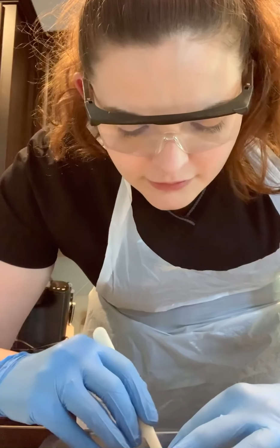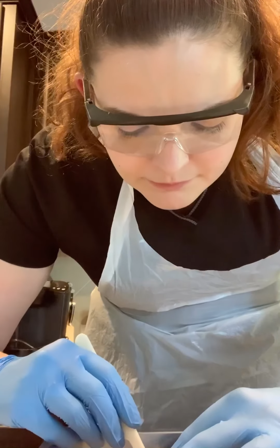And the cerebellum. Splitting my brain in half laterally. And this here is what we are left with, looking at the inside of the brain.